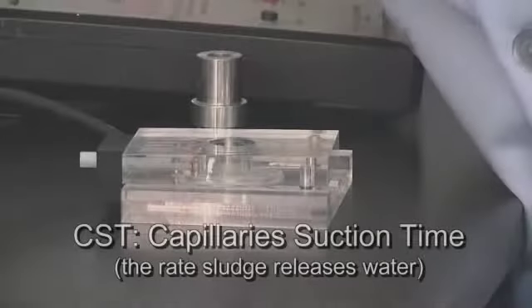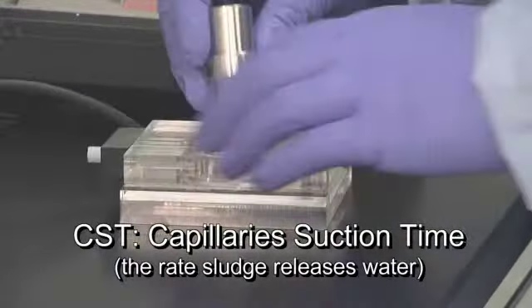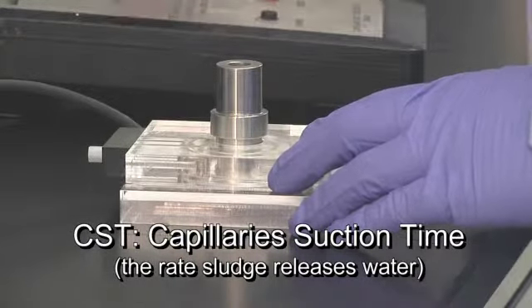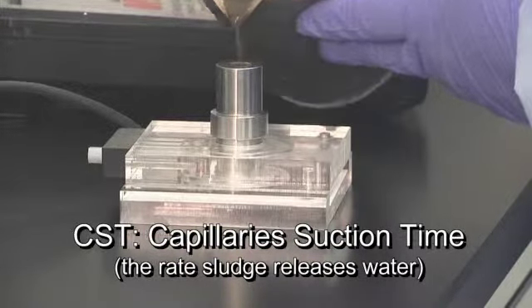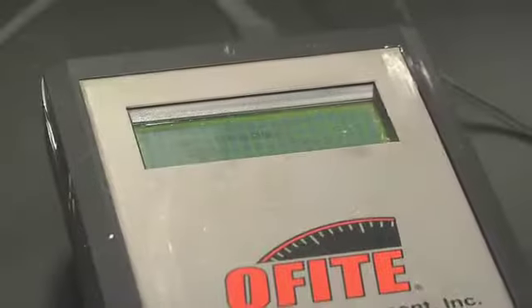A small amount of testing sample is poured into the cylinder on a sheet of chromatography paper. The paper extracts liquid from the sludge by capillary action. The results can be used to assist in sludge dewatering processes, to evaluate sludge conditioning aids and dosages.